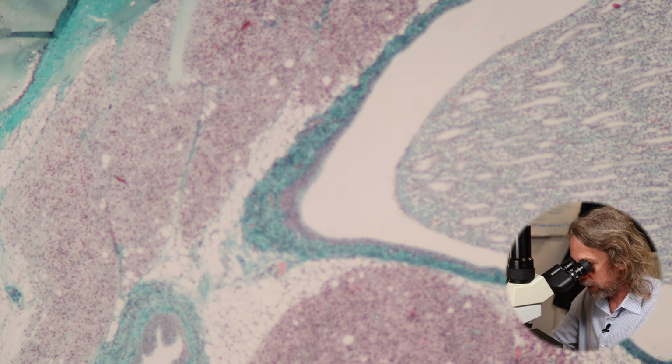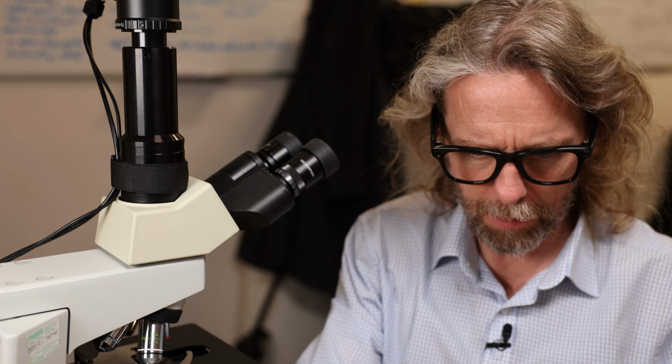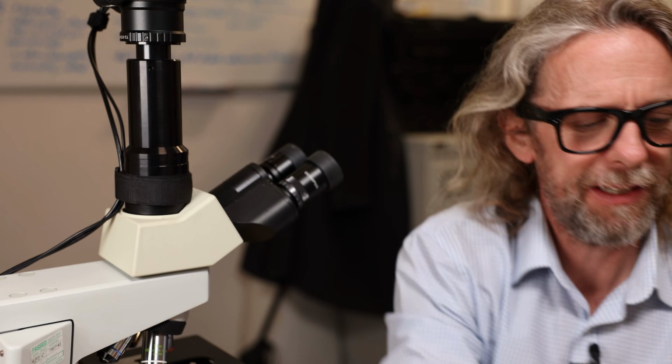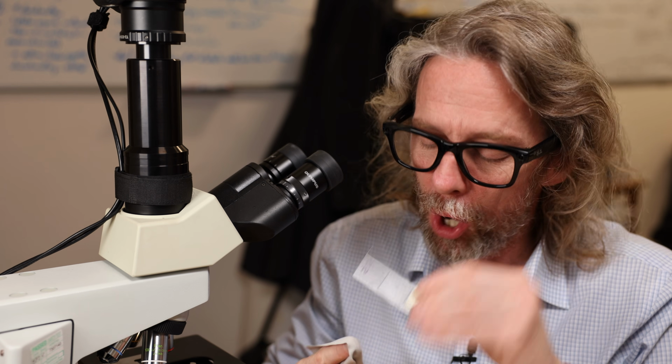So he told you I'd be quick. Let's have a look at the ureter. It's very pretty though, ureter. Okay, it's tiny. Here's the ureter. Again, I don't know what animal this is from. This is a collection of slides that was bequeathed to me. Lucky you guys. Look at that.